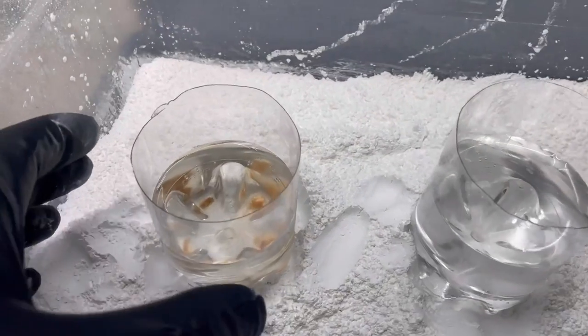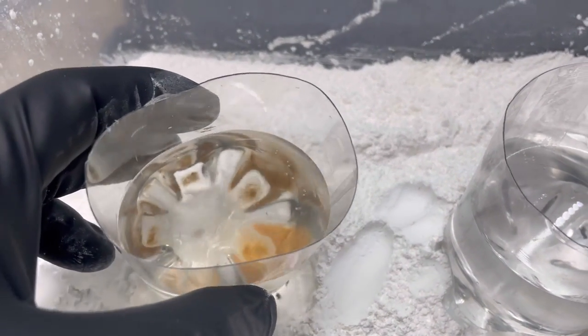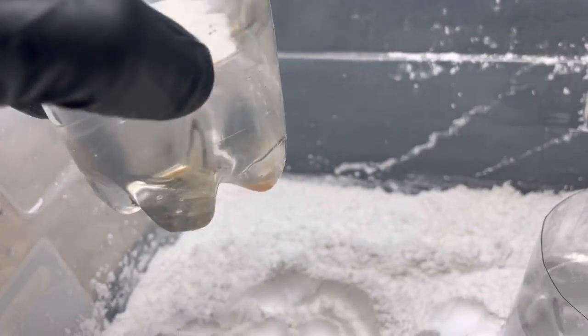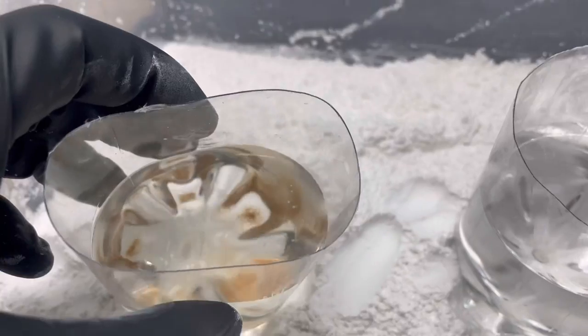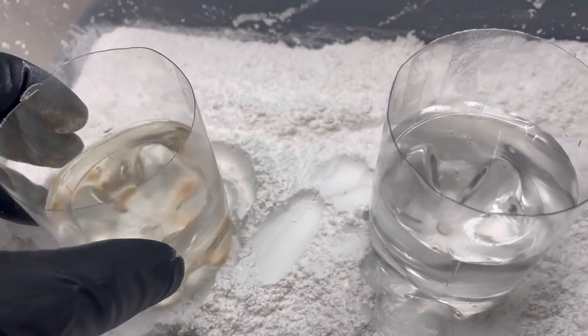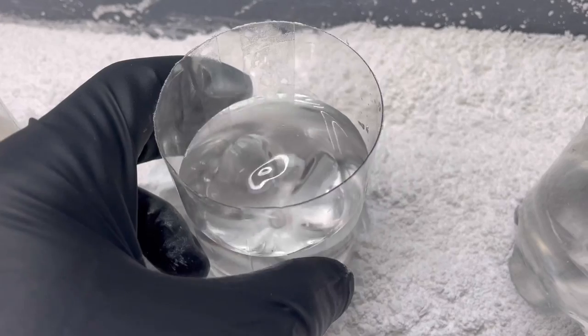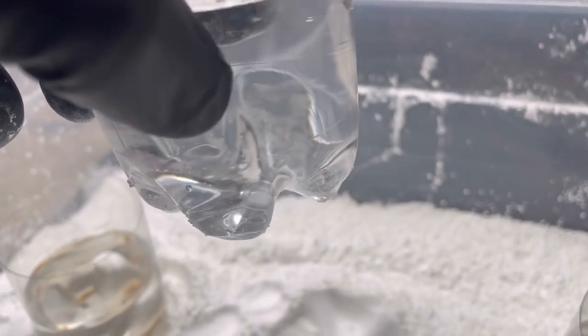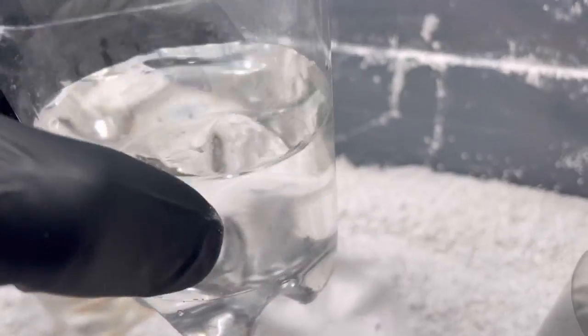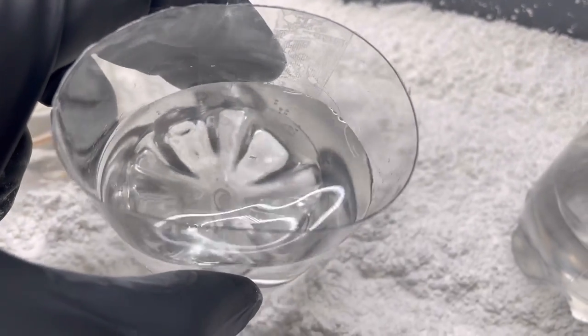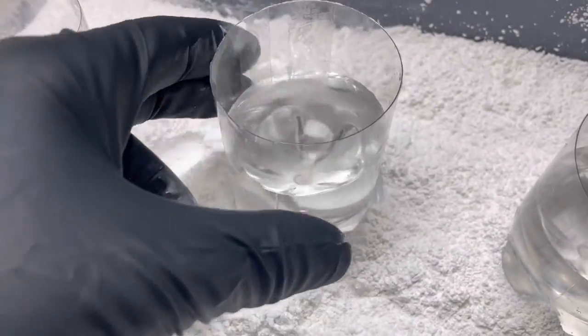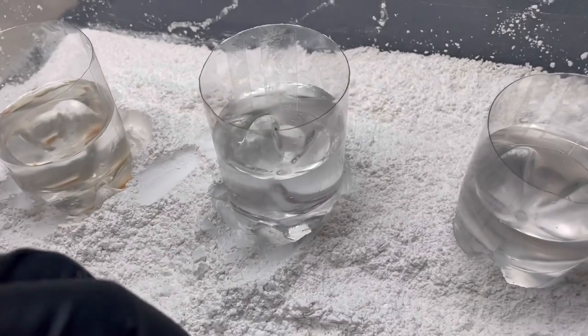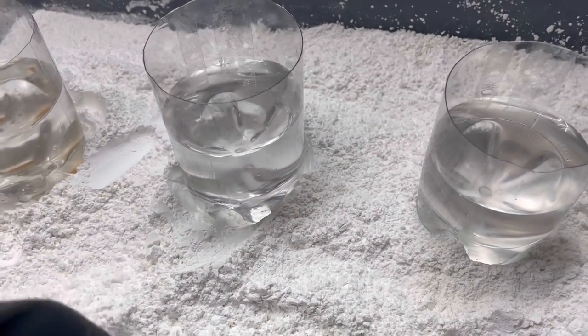So let's have a look at the solutions that are remaining. You see the one that had the flint has got some reddish brown sediment at the bottom. I'm guessing that's mostly calcium fluoride with a little bit of iron staining, stuff that isn't dissolved by the acid. The agate has similar but the sediment in this one you can barely see is basically pure white. It doesn't have that iron in it. That's really the difference between agate and flint. Agate is more clear, chemically they're basically the same, they're both made of chalcedony.